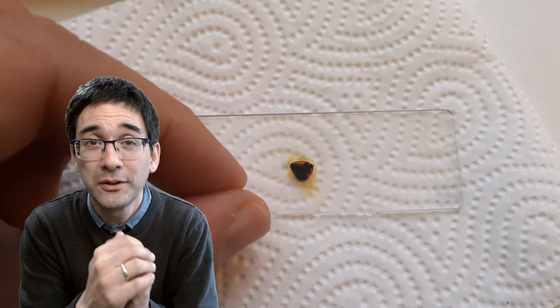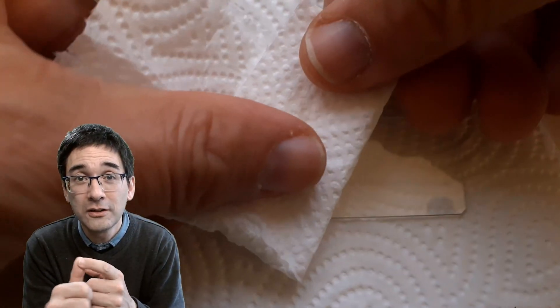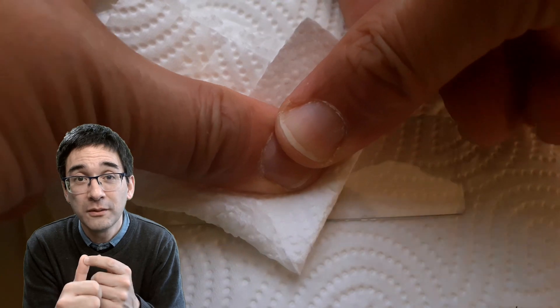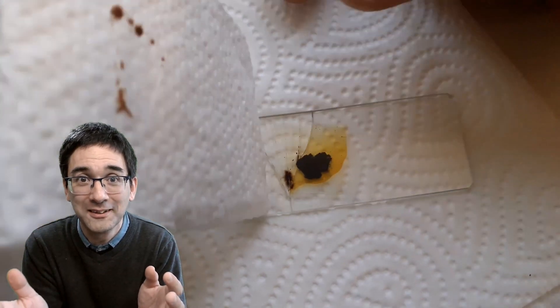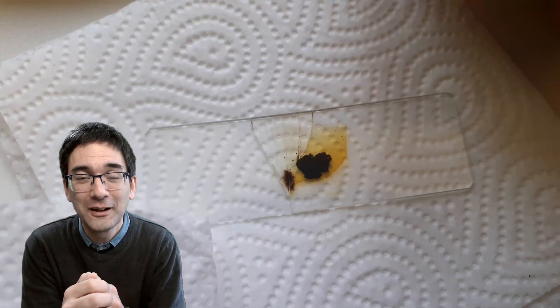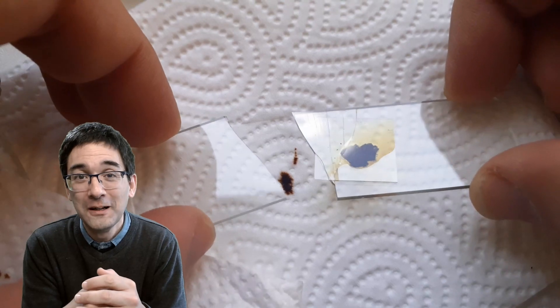And this is a thing where you have to be a little bit careful that you don't hurt your thumb, because if the cover glass breaks... look at this, not only the cover glass broke here but the whole microscope slide broke here.